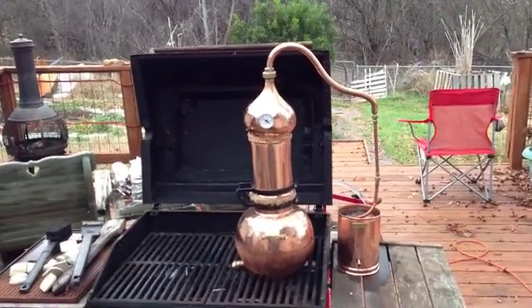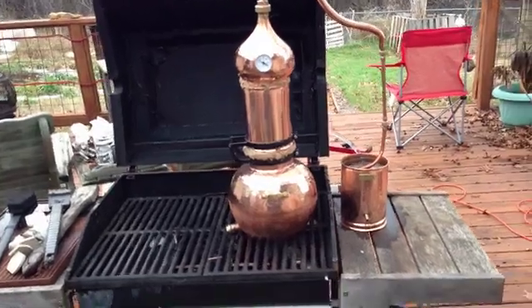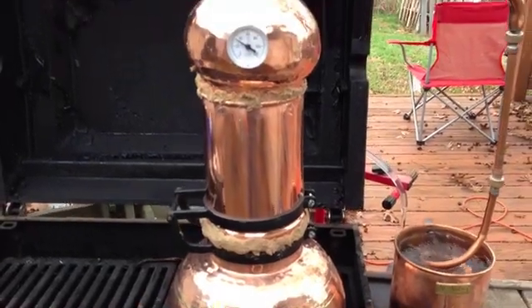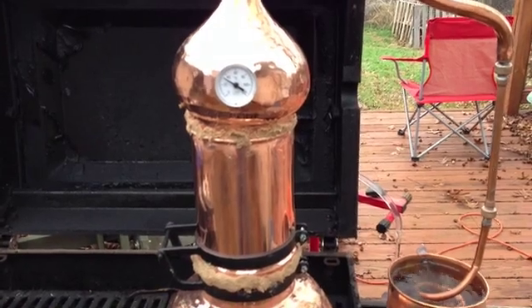The water is contained in the bottom part — the big bulb down at the bottom, that piece. And then above that is where the herbs will go, in those two pieces. You can see the thermometer there that started this process.